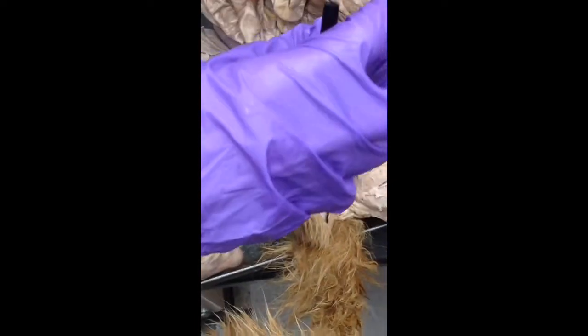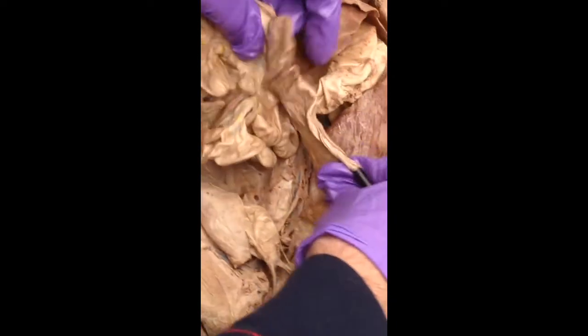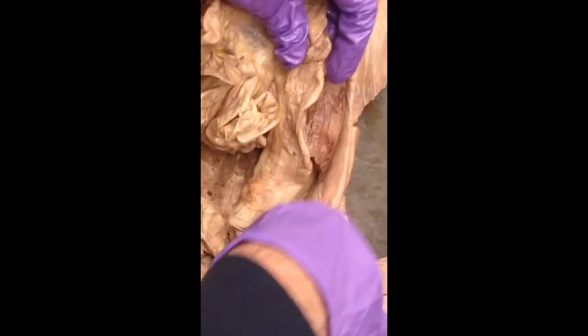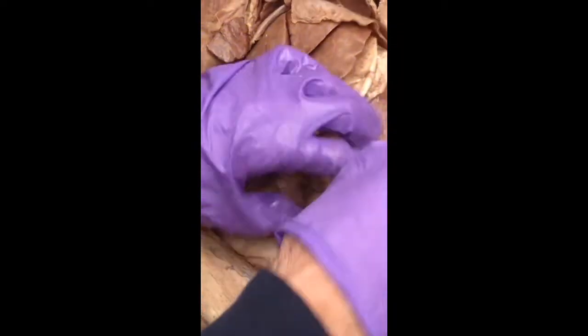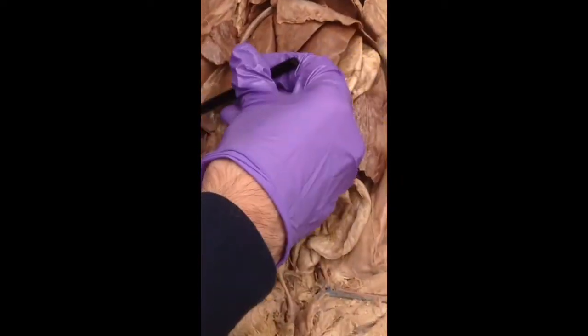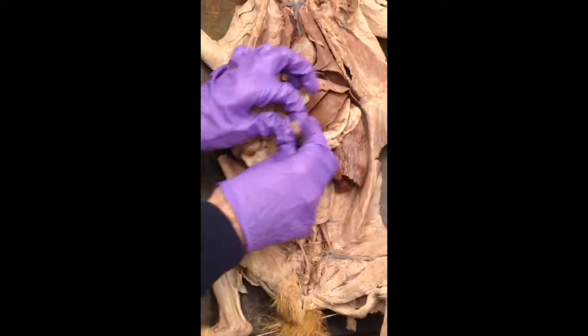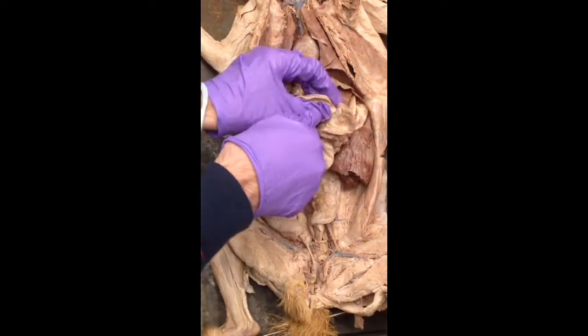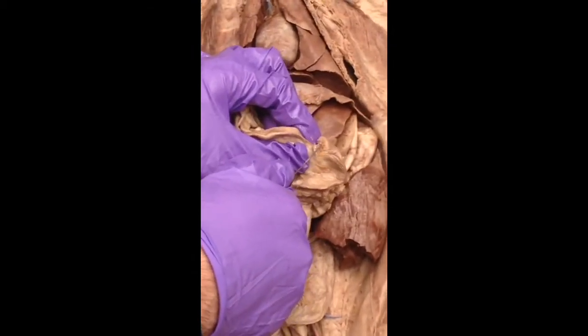Greater omentum was all that fatty stuff that was covering all this. Mine's all gone, but it was there. And then here's our large intestine. Following it, there's a descending, which means it goes that way. There's a transverse, which means it goes across. And there's also an ascending portion of it. So descending goes this way. Transverse goes that way. Ascending goes up. Follow it all the way back to here. All right, that little nub, that's the cecum. That's essentially its appendix there.